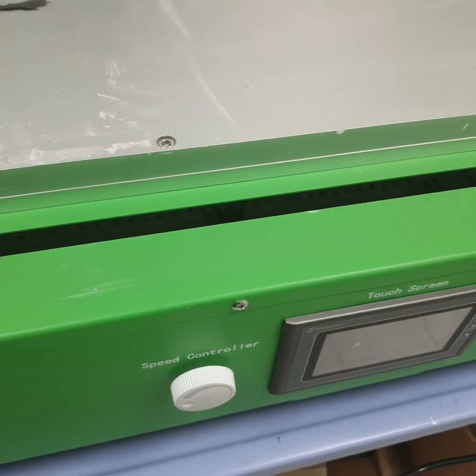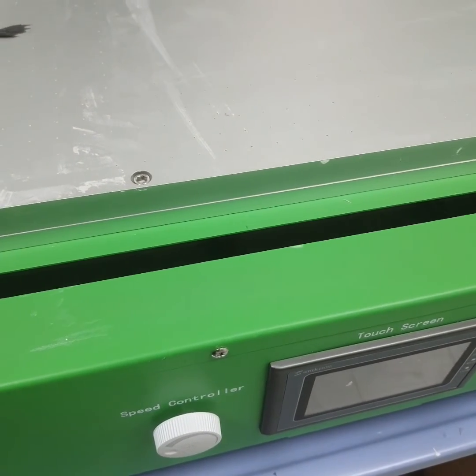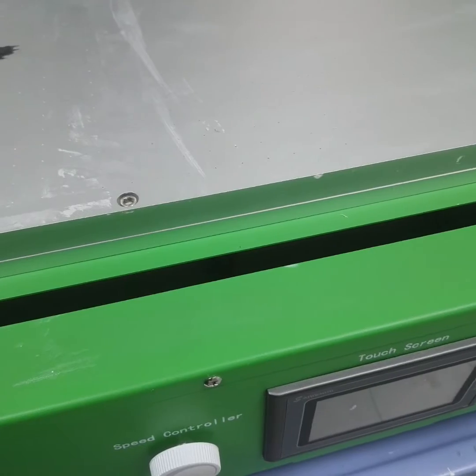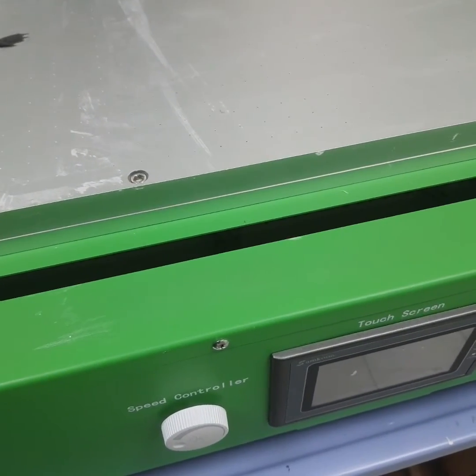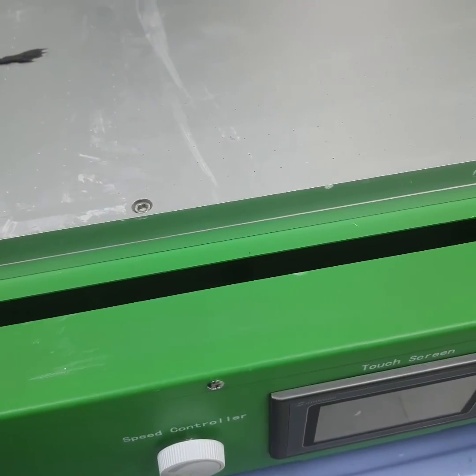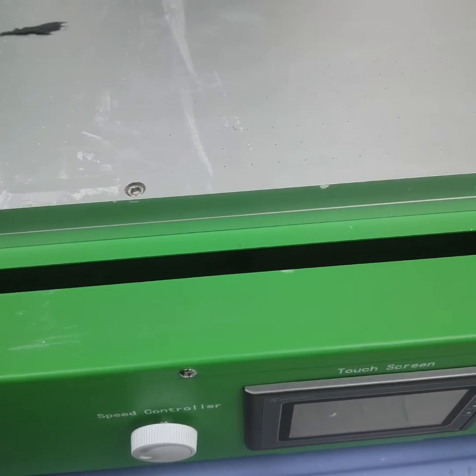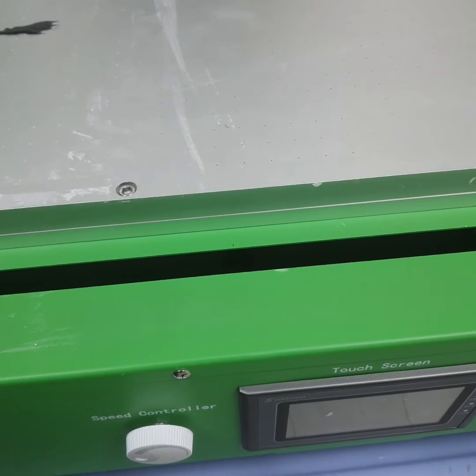You can also define phase inversion as the methodology of controlled polymer transformation from the liquid phase to a solid phase. There are four basic techniques to create phase inversion membranes. The first one is precipitation from vapor phase. Second is precipitation by controlled evaporation. Third is thermally induced phase separation. And the last one is immersion precipitation.